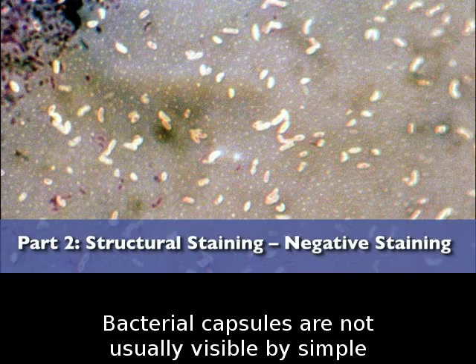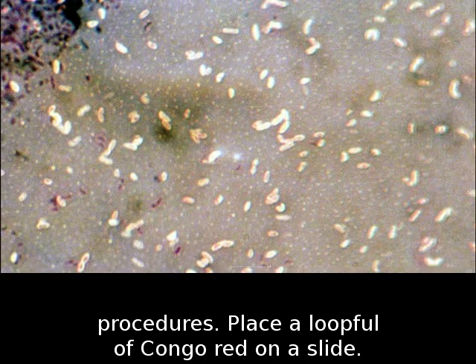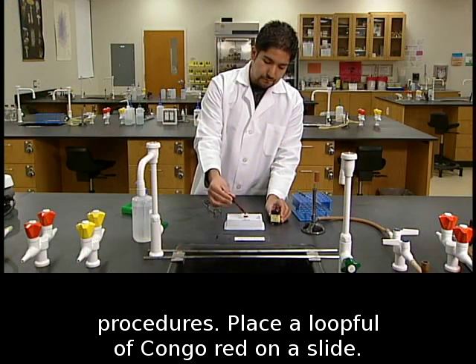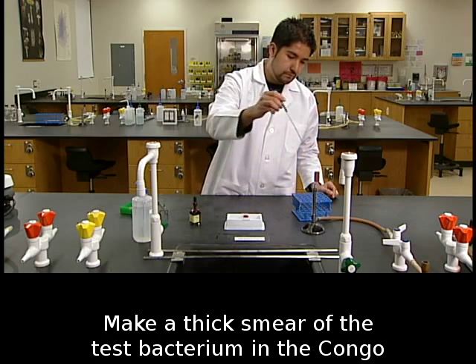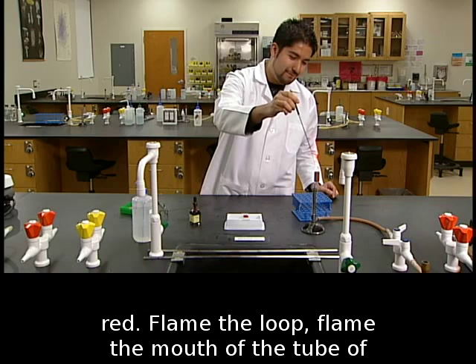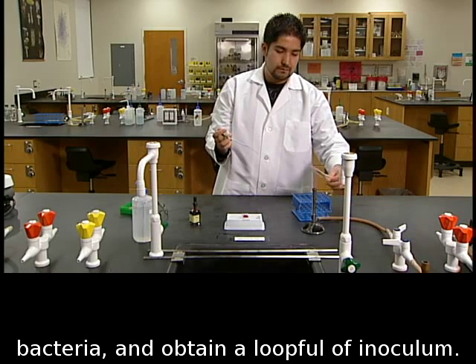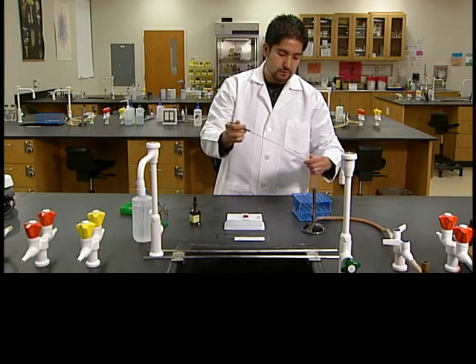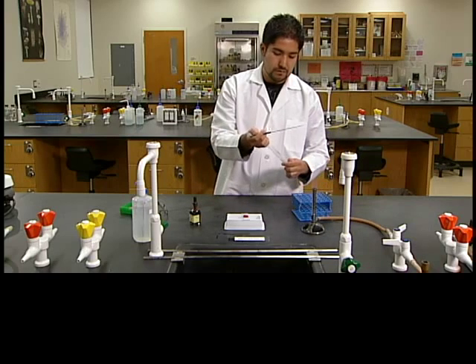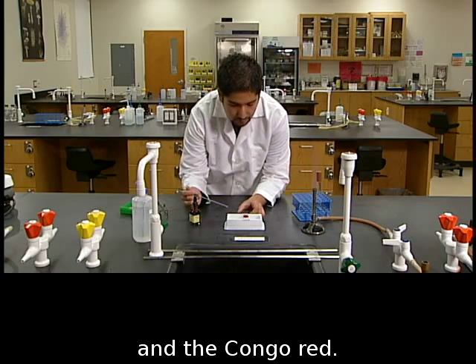Bacterial capsules are not usually visible by simple staining, but can be seen using negative staining procedures. Place a loopful of Congo Red on a slide. Make a thick smear of the test bacterium in the Congo Red. Flame the loop, flame the mouth of the tube of bacteria, and obtain a loopful of inoculum. Make an emulsion on the slide with the bacteria and the Congo Red.